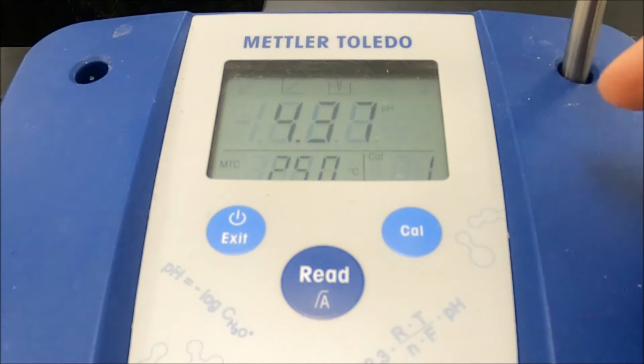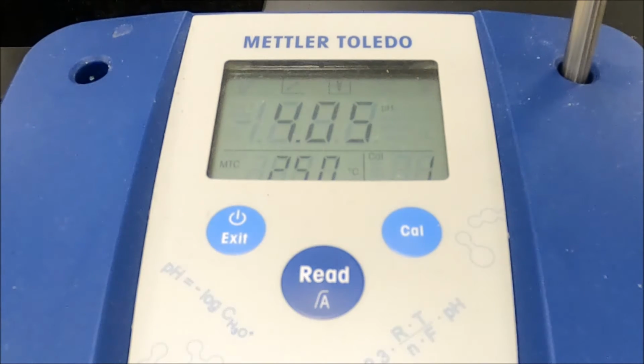So it's calibrating off of 1 point. You see it's kind of adjusting its pH. It's kind of going down. Swirling it, make sure that everything gets kind of where it needs to be. I'm going to let that sit and calibrate while I pipette 20 milliliters of the acid solution I just made into Erlenmeyers like we did last time.